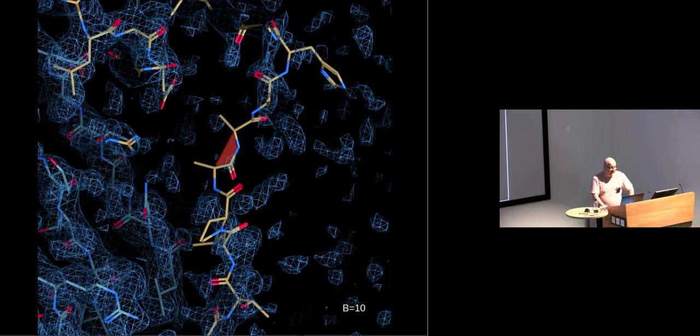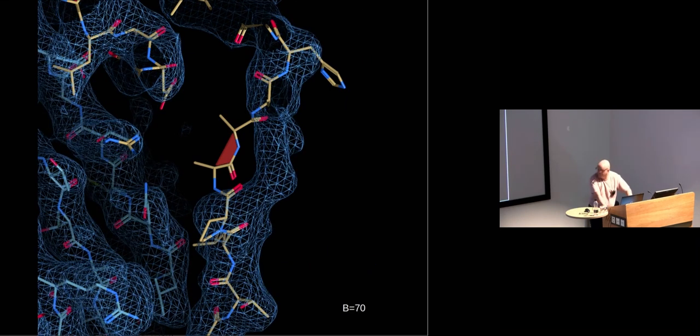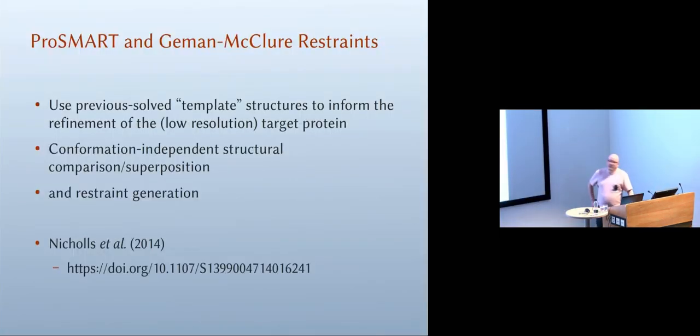So what I'm going to do is display a set of reconstructions that have B factors applied. And you can see by adjusting the B factor that there is indeed a better place that we can move that peptide, or those few residues, to better fit the map. So it's a good idea, generally speaking, and this is what I do and I recommend it to you, to look at a series of differently sharpened or blurred reconstructions. That helps your interpretation of the map.